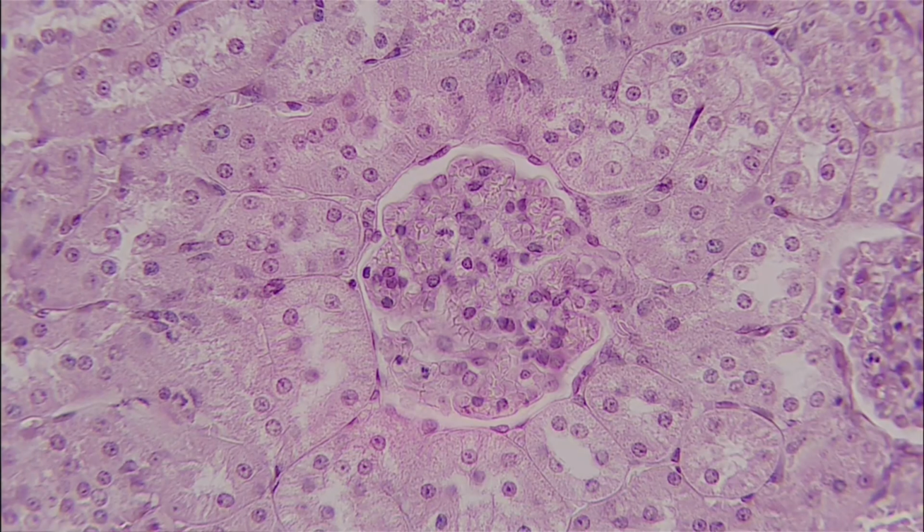So to start us off, we are going to look over 4 different categories of tissue: epithelial, connective, muscle, and nervous. So to start us off, we're going to look at epithelial tissue. And something that I think people really struggle with epithelial tissue is knowing where to look. For a lot of these slides, you're going to be wanting to take in the whole picture, but for epithelial tissue, we're just looking from the apical to basal surfaces.